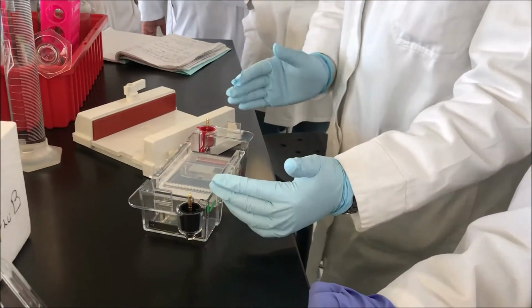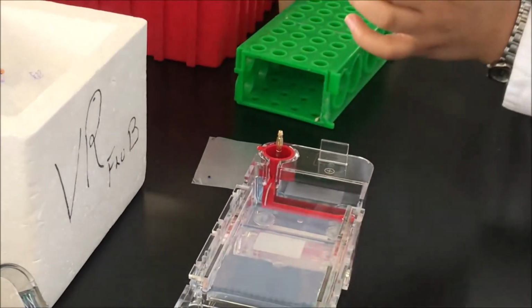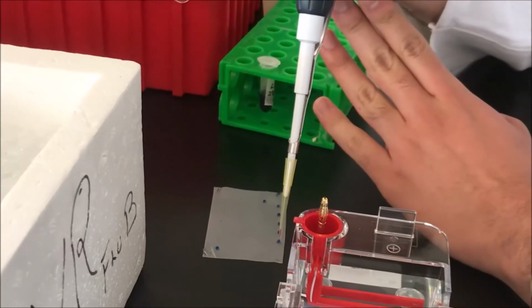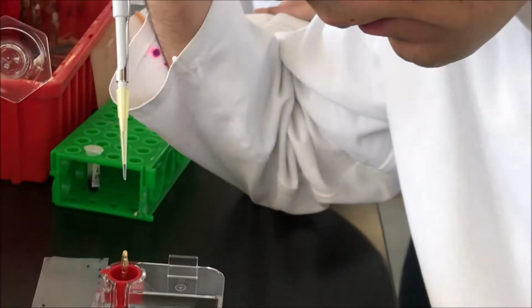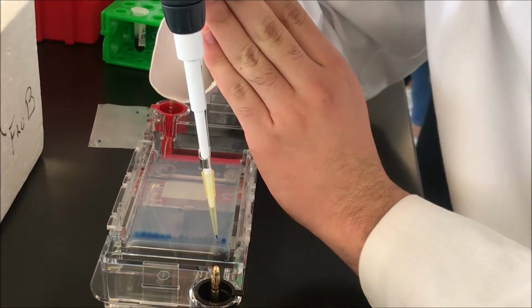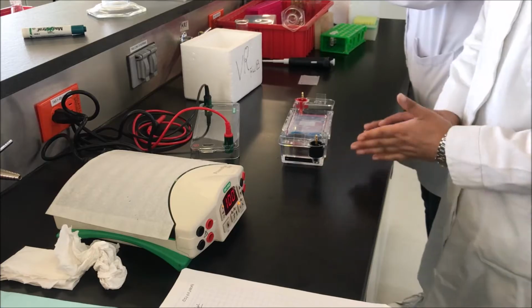Now it's time to place the gel in the electrophoresis chamber and cover it with buffer. Add the appropriate amount of loading buffer on a piece of parafilm. Also add the required volume of the DNA sample and then mix DNA and loading buffer with a micropipette. In the first well, add 5 microliters of the molecular weight marker and then add the mixed samples in the indicated wells. Now, run the samples for 60 minutes at 100 volts.